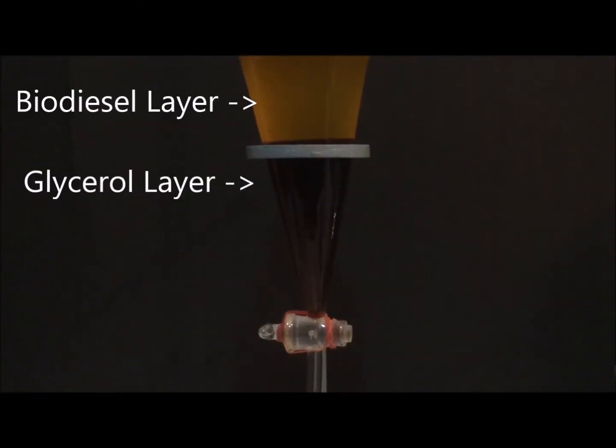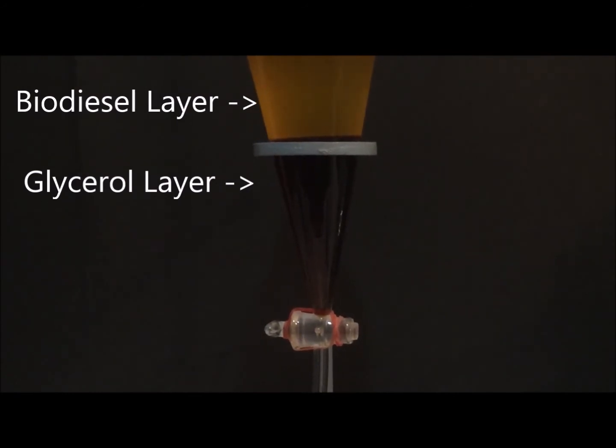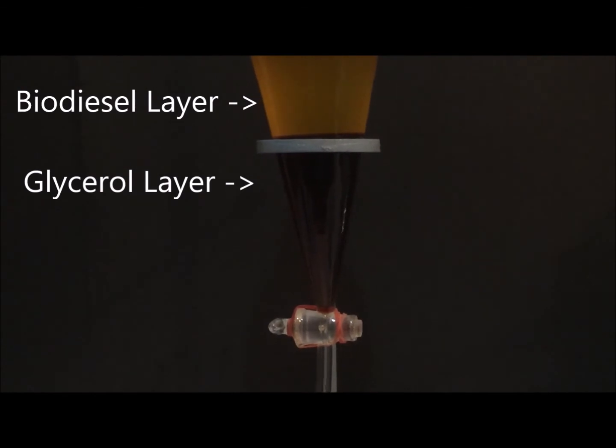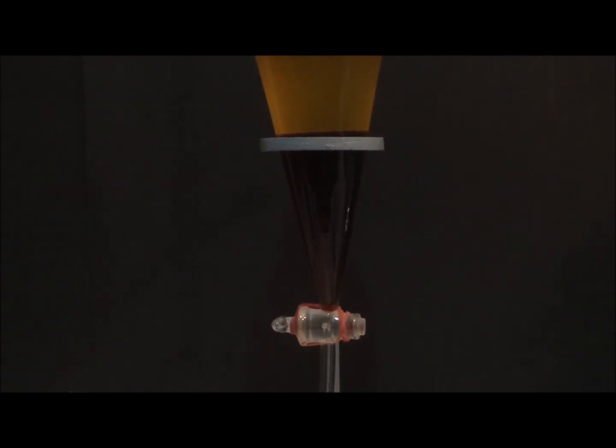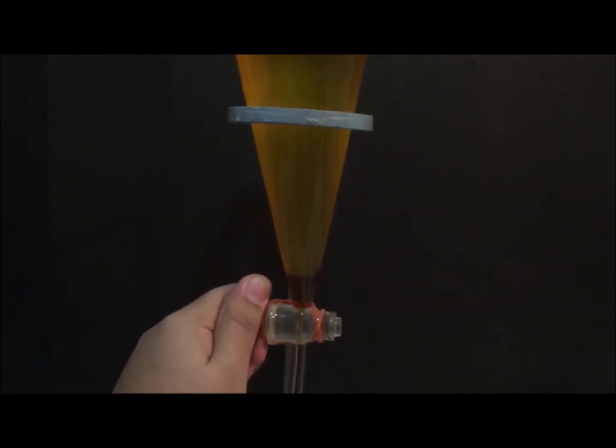The reaction mixture is allowed to cool before being transferred to a separatory funnel, where it is allowed to settle over 7 hours. Glycerol, catalyst, and unreacted methanol, as well as other impurities, sink to the bottom, while biodiesel forms the upper layer. The lower layer is then extracted and discarded, and biodiesel's crude sample is measured to assess the crude yield before washing.